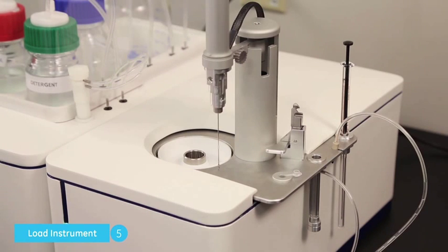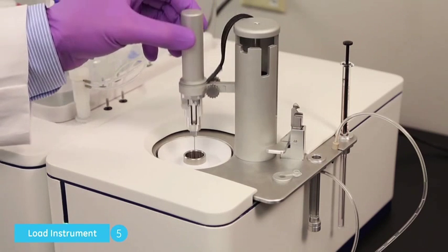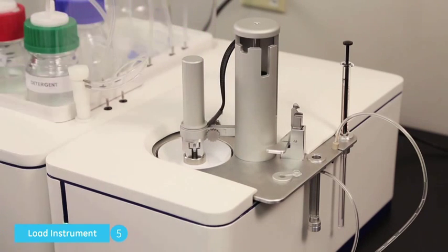If your cell is loaded, you may move the pipette into the cell. Be sure the pipette is firmly seated in the cell port. You may now start your experiment. Click Done.